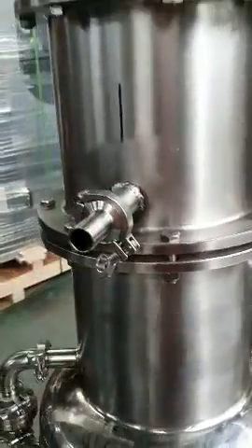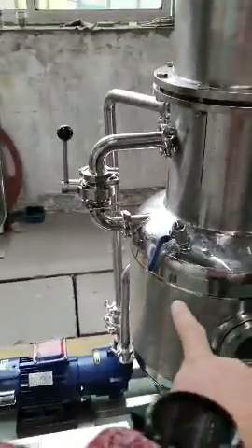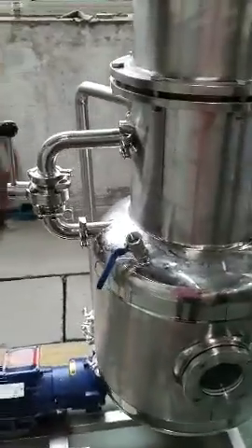The condensing coil takes it into the second part of the system. This is all jacketed and goes back again into your chiller, which is circulated. This part of the system is for the water to cool the pump, which is running continuously. Then we have two ball valves here.